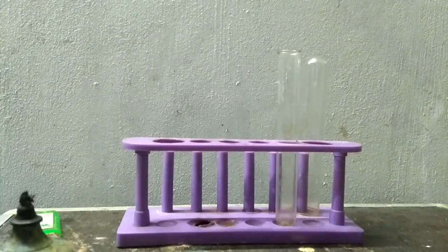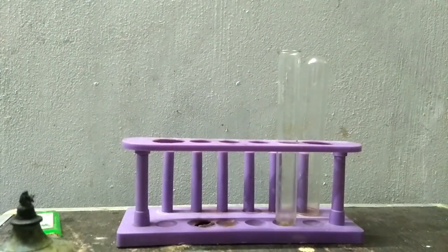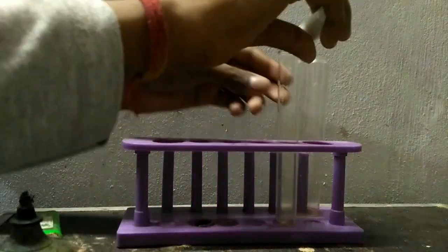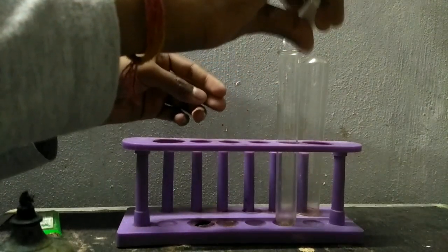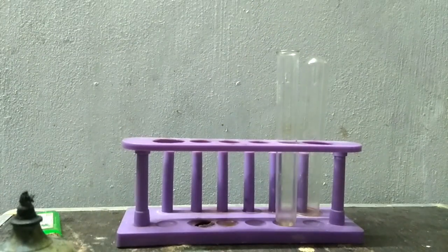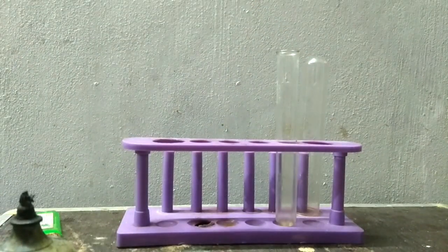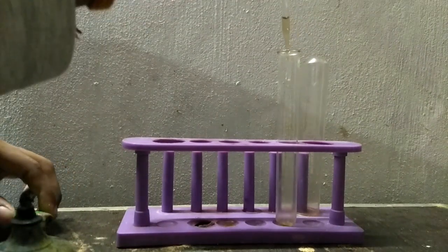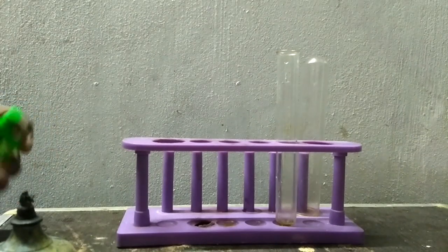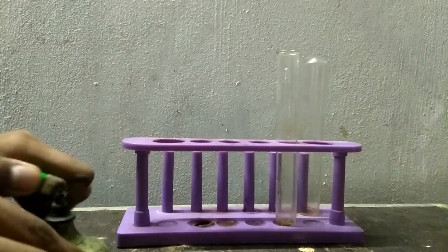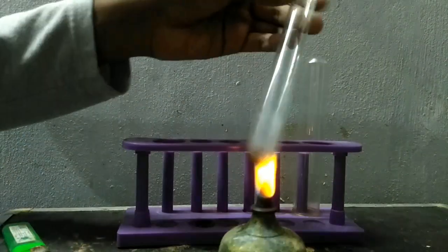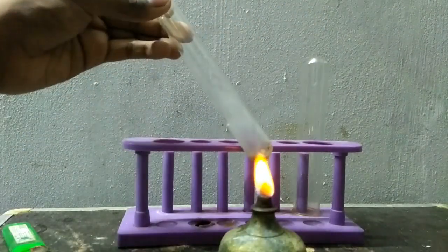In this test you don't need much quantity of compound. Just a pinch of compound is sufficient. Then I will add phthalic acid, a few drops of concentrated sulfuric acid.